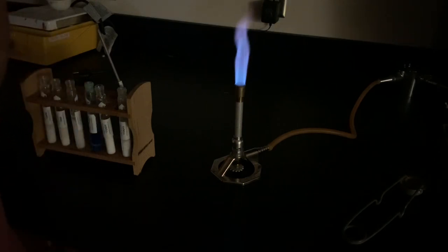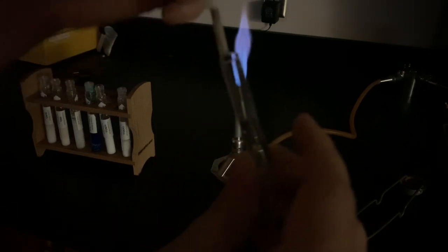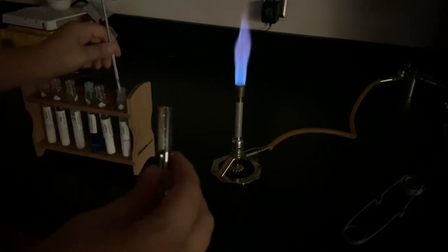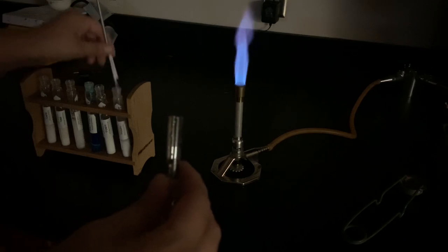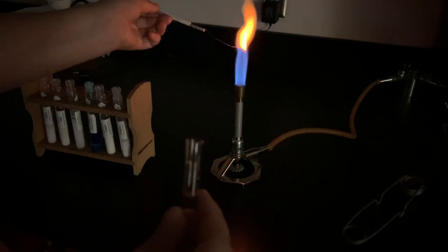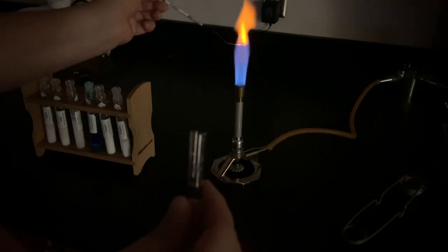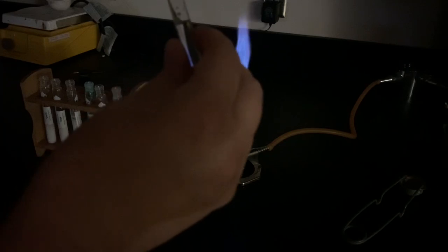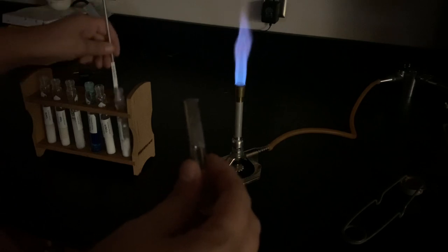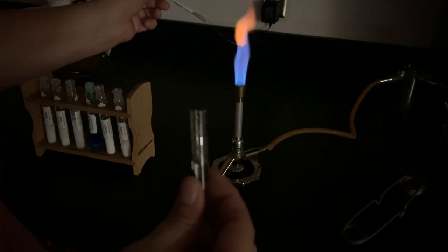One more time — clean water and clean inoculating loop. The last one I'm going to do is calcium. I dip my loop into the clean water and then into the calcium nitrate salts. Calcium is also kind of an orange color, but with a little bit more red than the sodium.